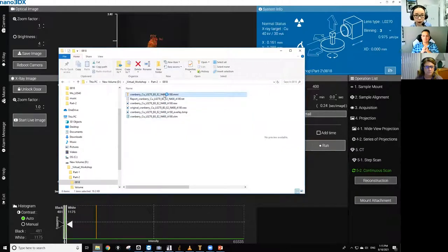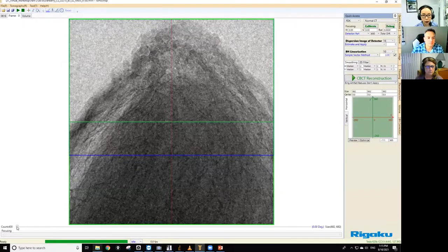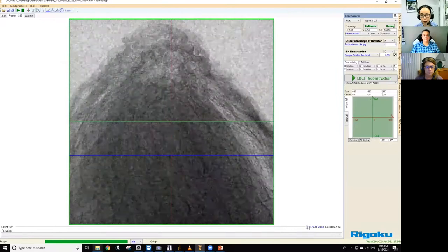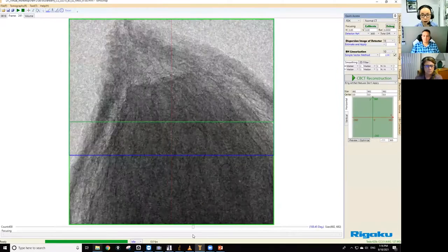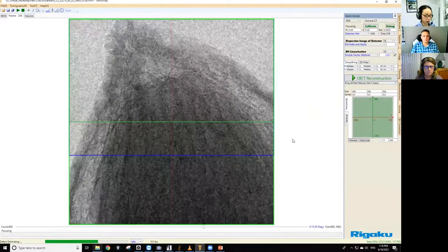Well, let's take a look at the cranberry scan that we just did. So we're going to open the file. So we have 400 projections. It was a quick scan, so it's a little bit noisy, but we do see some details. And usually you would do center correction at this point, but I got everything aligned so that we can use zero as the center value. So I'm going to just go ahead and reconstruct it. This will take probably a minute or so.